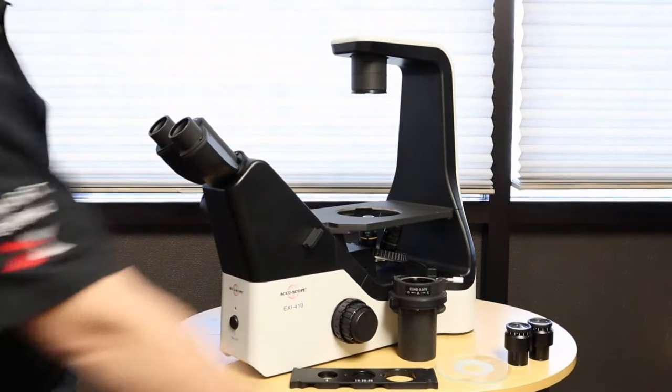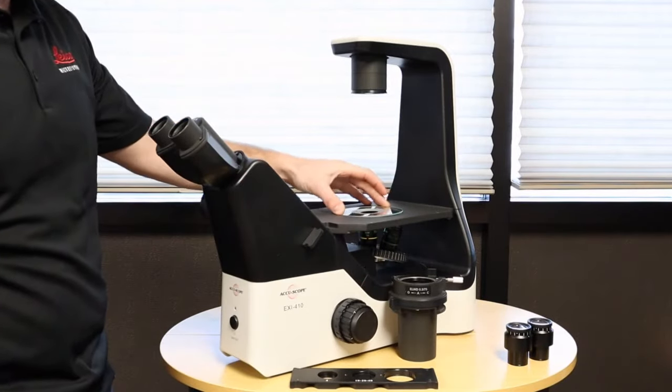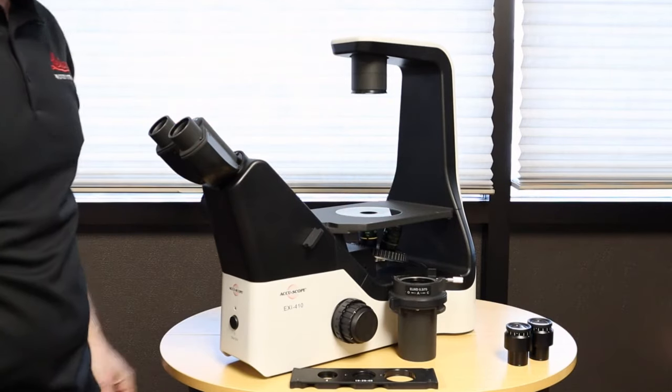First thing we are going to start with is our clear plate. So this plate goes simply in the stage well to prevent your samples from falling through.